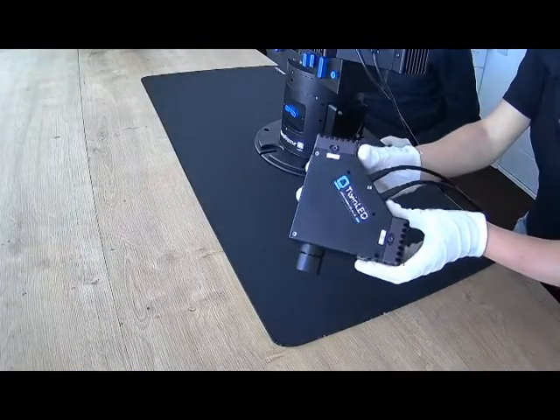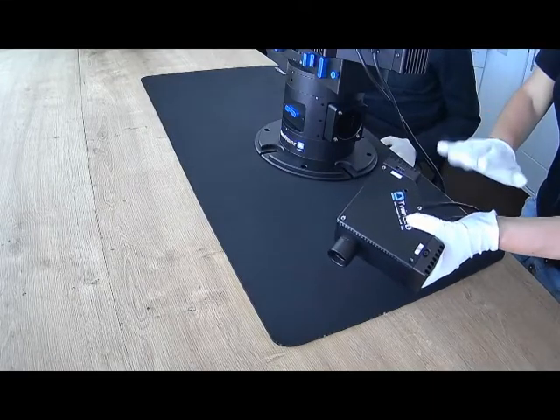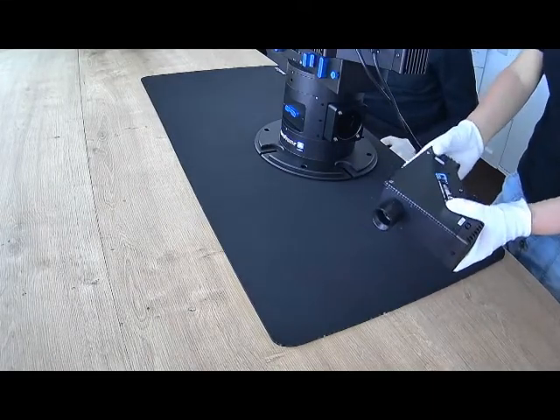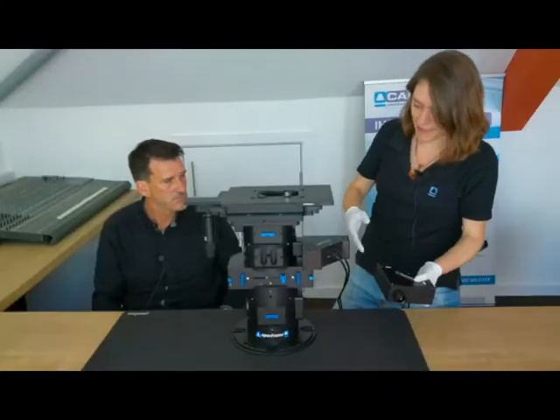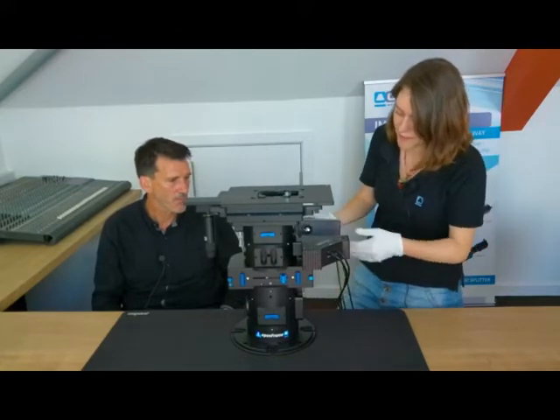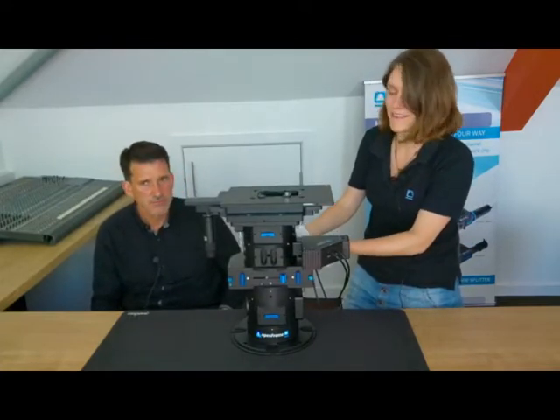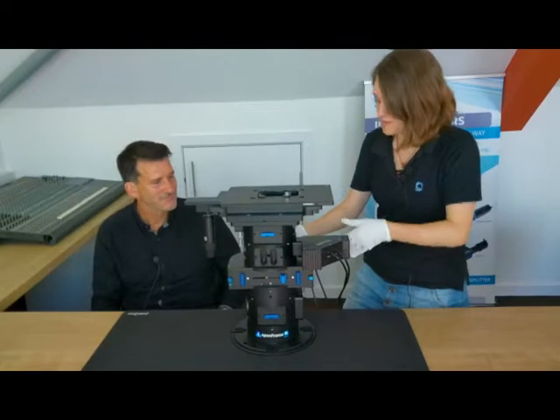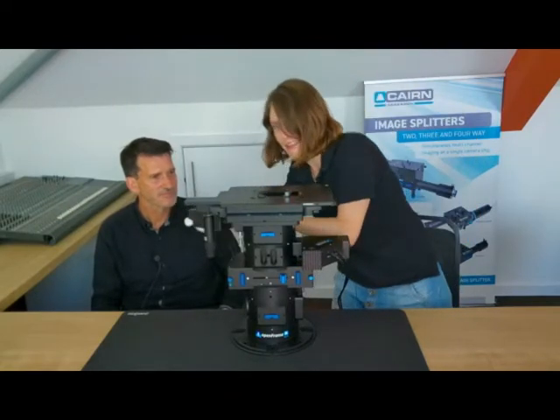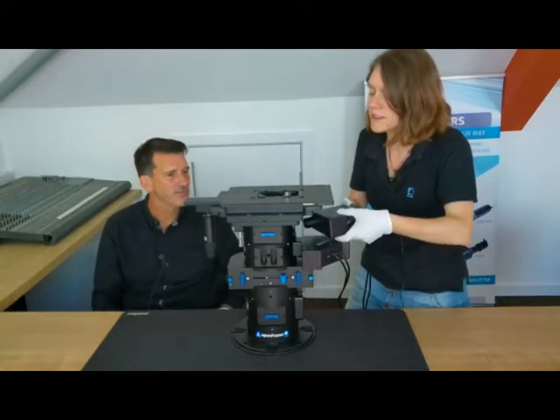Most people are going to want to do other dyes other than Fura 2, so we've also got our twin LED housing. Same footprint, it tends to have visible wavelengths in here. So for example, we've got blue and white in here to cover most common dyes. You might be thinking, oh, you've taken up the epi port, so where are you going to put this? Well, we've got a couple of places it can go. So they've got the dual infinity slider under here, so it can just be mounted on the back, so you can't see it because it's not clashing with anything. It can also go onto the focus layer on this side. On this side, as Jez mentioned earlier, there's still space in there to bring in an extra light source.